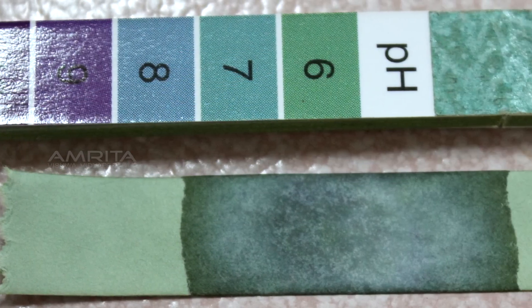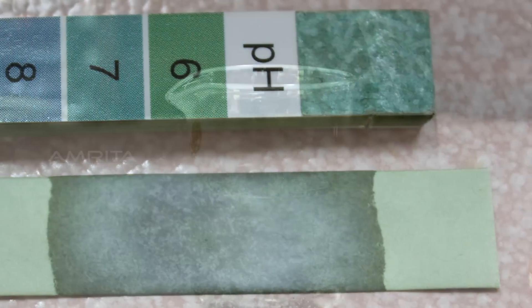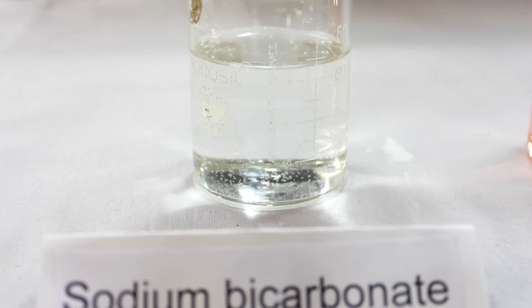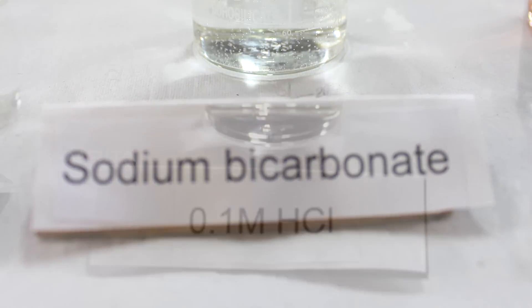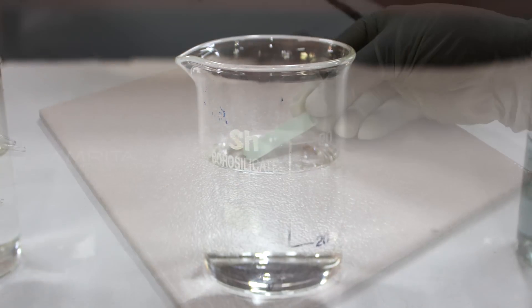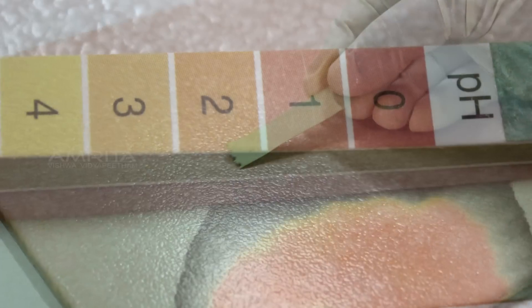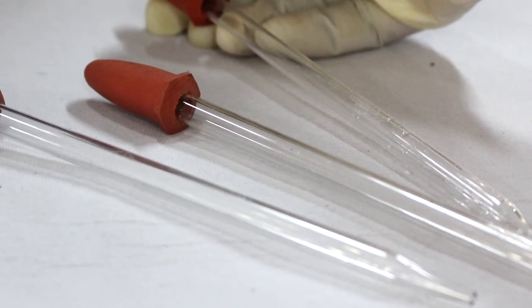The pH value of common salt is 7. Repeat the same step for finding the pH value of sodium bicarbonate solution and 0.1 molar HCl using fresh strips of pH paper, universal indicator and separate fine droppers for every sample.